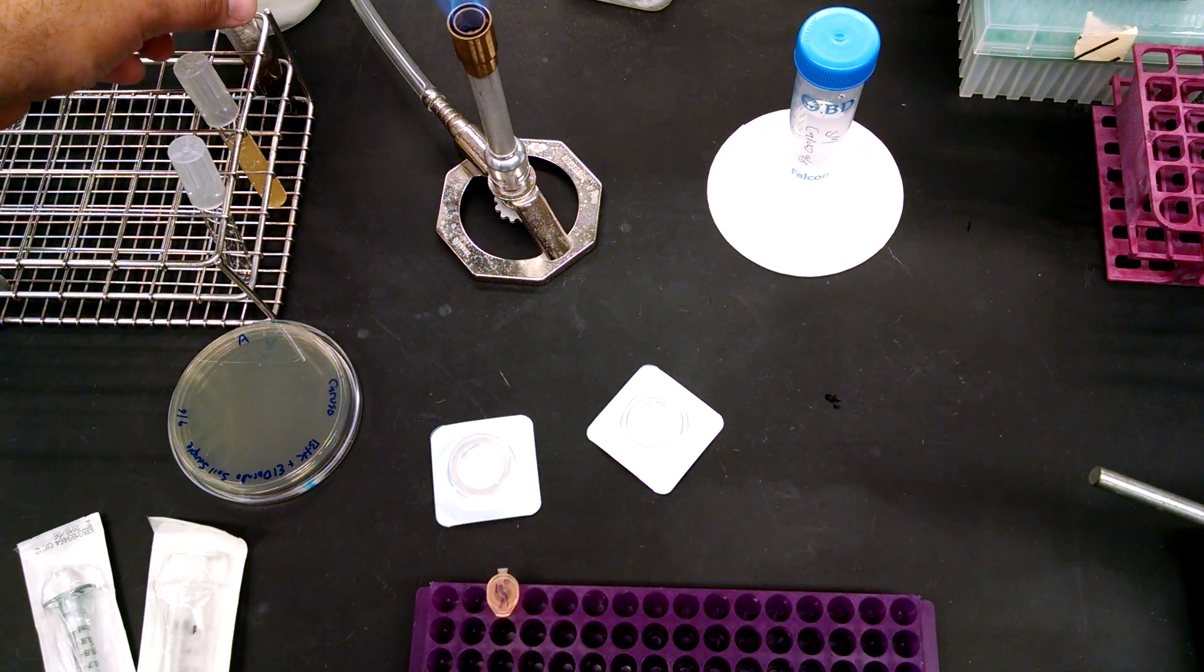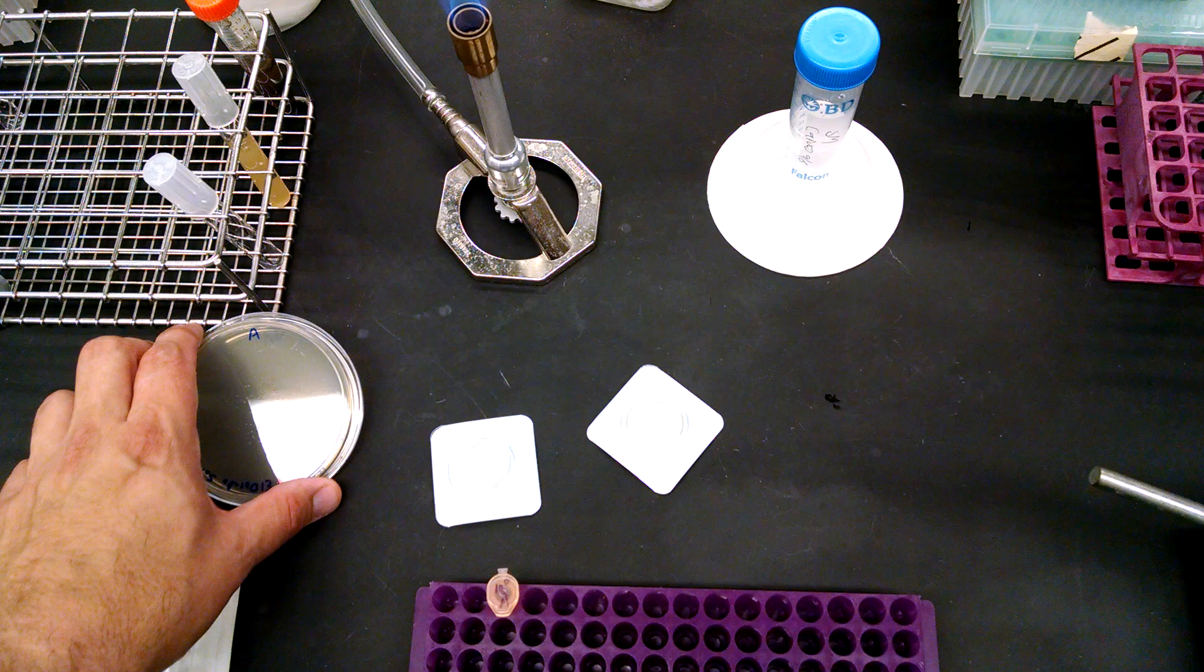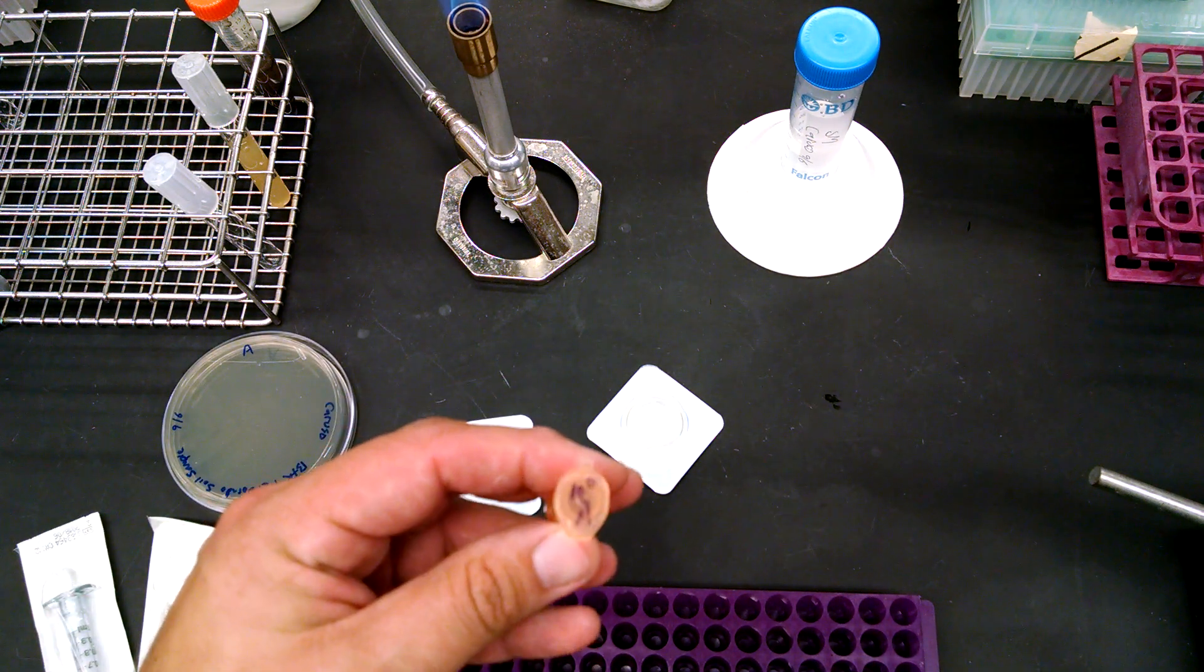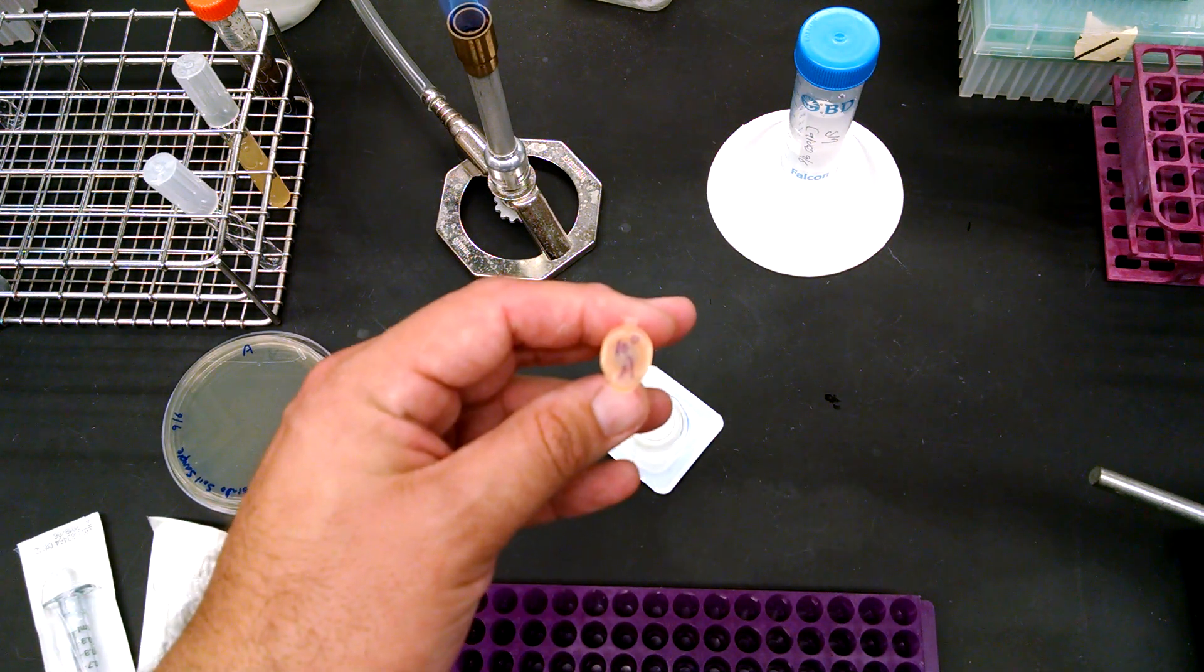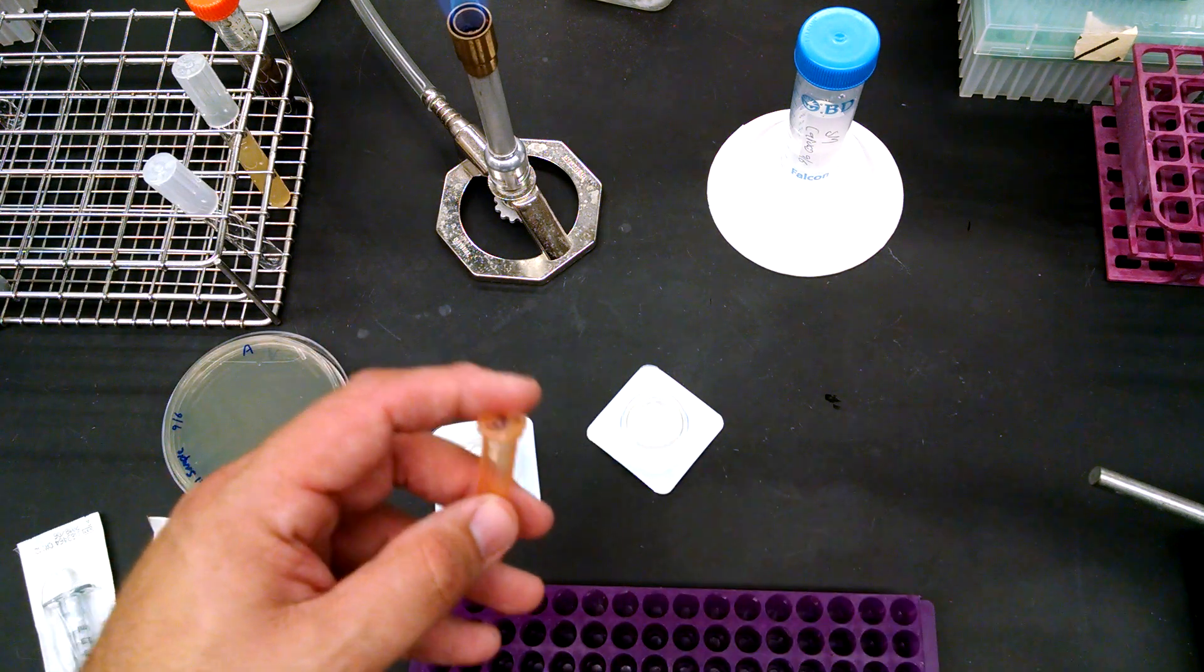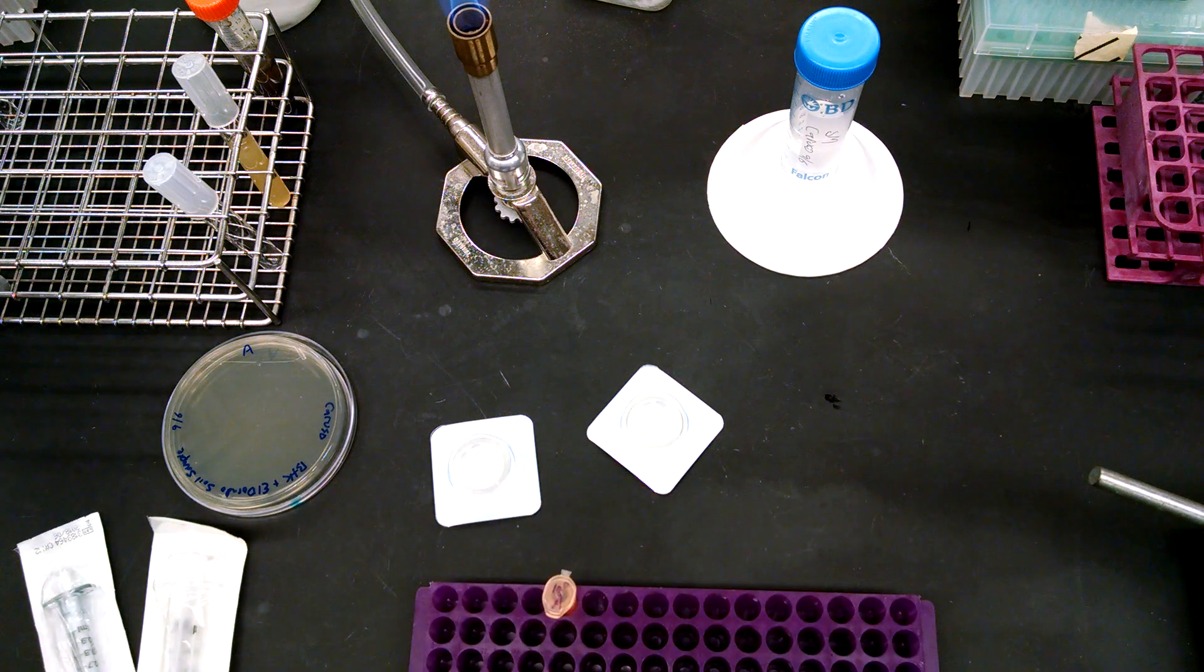Now, I only have one sample here prepared, and I have something I'm going to demo, and I have a plate for doing an infection in a tube that I've already labeled ready to go. I've labeled it A for sample A and 10 to the zero because we're not going to dilute it, but you want to have everything ready to go.